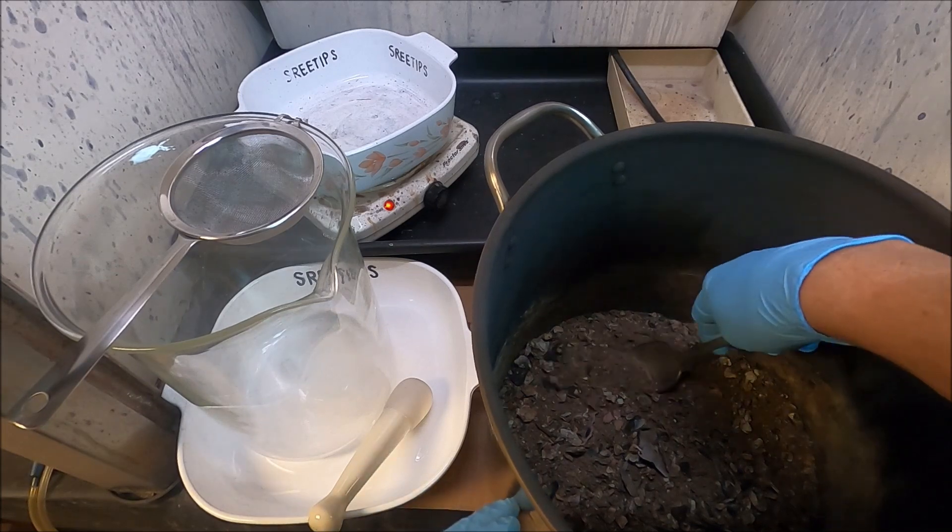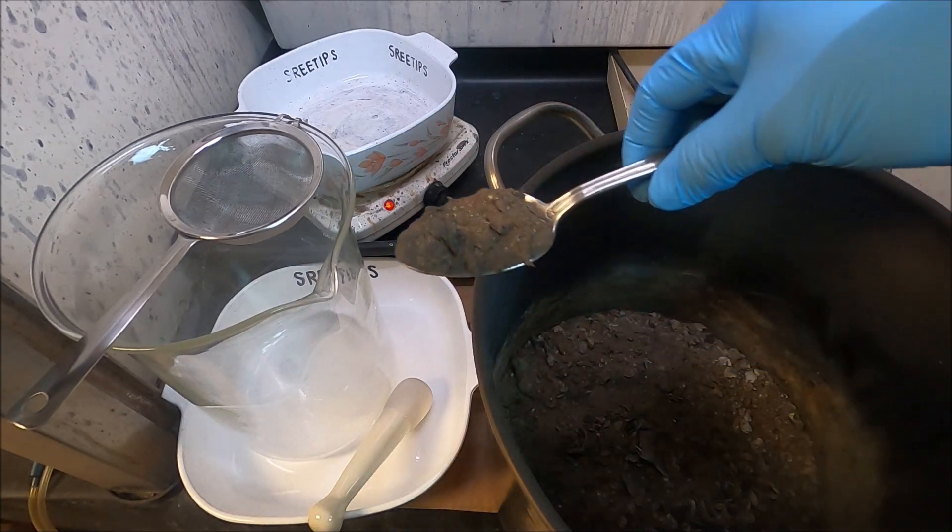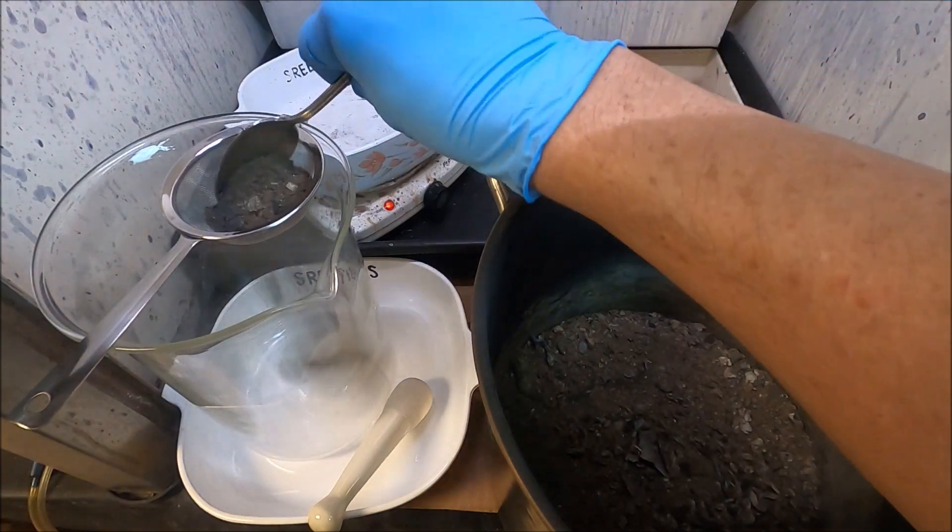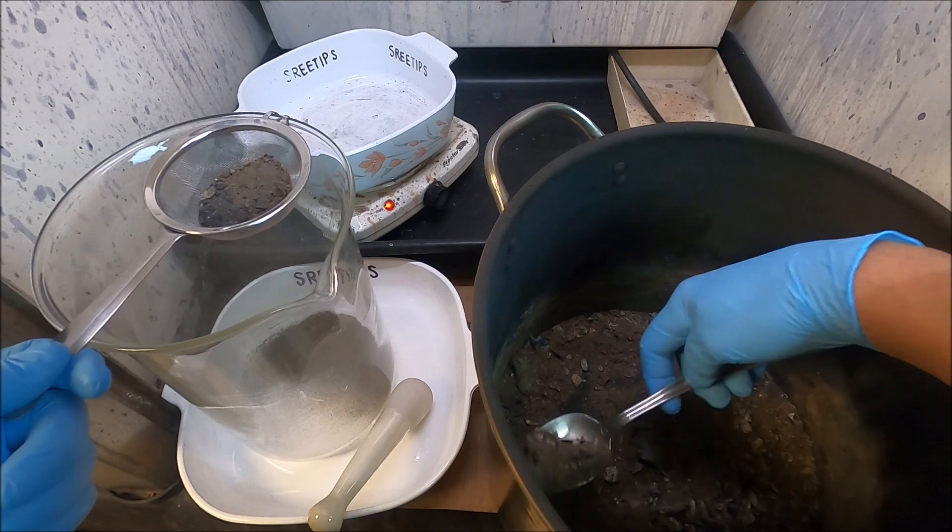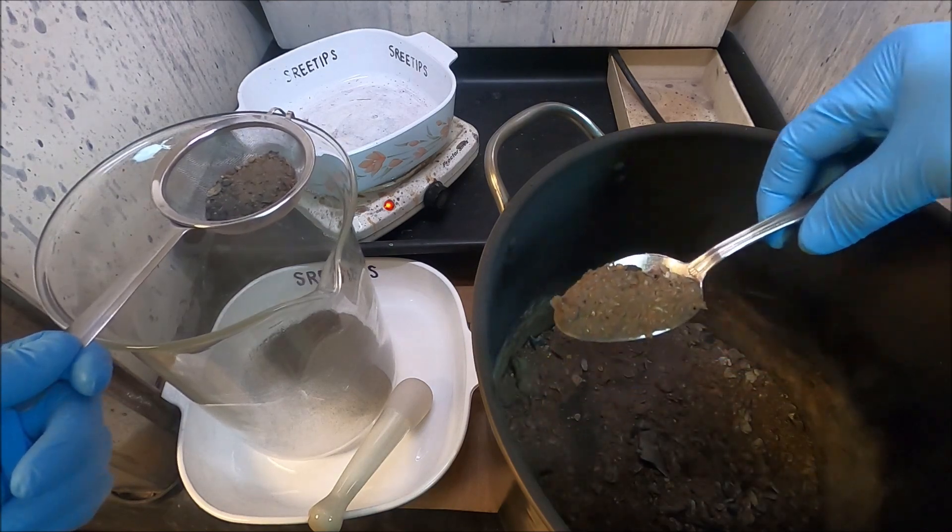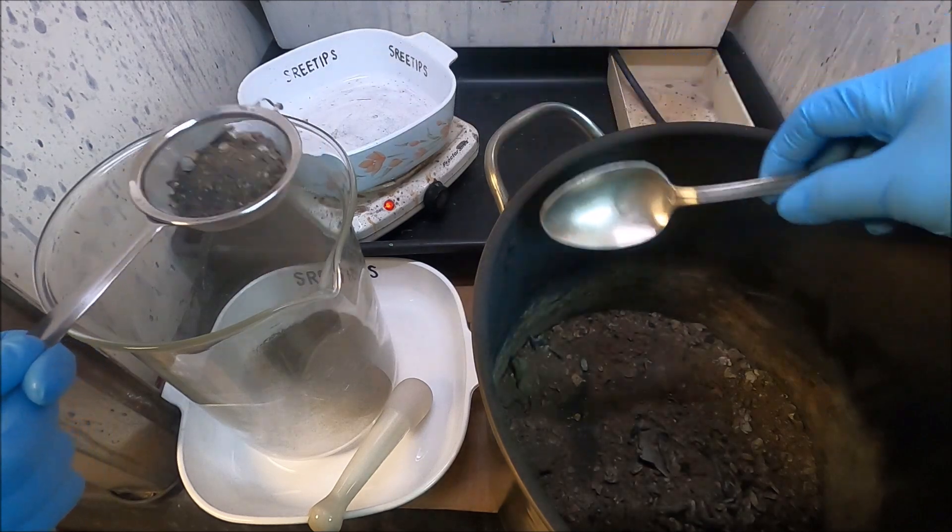All right, here's our ash. What I'm gonna do now is spoon it up here into a strainer. We're gonna get it to a finely divided state here so we can work on it with some acid.